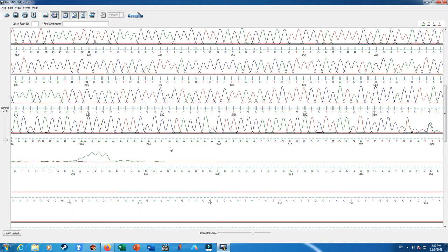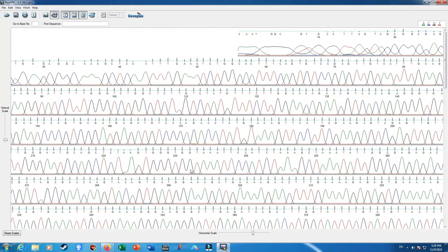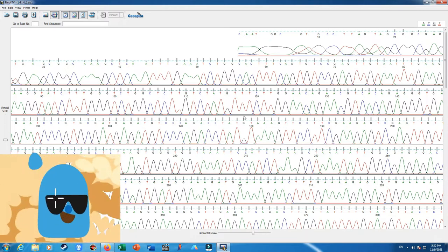So the sequencing result is pretty good, and the peaks are separated. The distance between the nucleotides is very important. They must be similar. As you can see, the T to G distance is quite similar to G to C, C to G, and G to A. Peaks start and end before the next nucleotide fluorescence peak starts. So I feel that this sequencing is quite reliable and we can proceed.